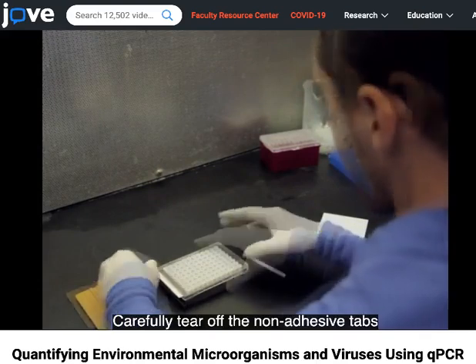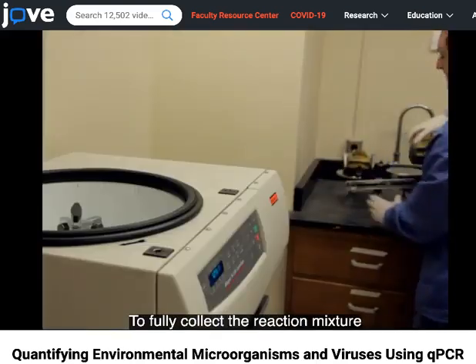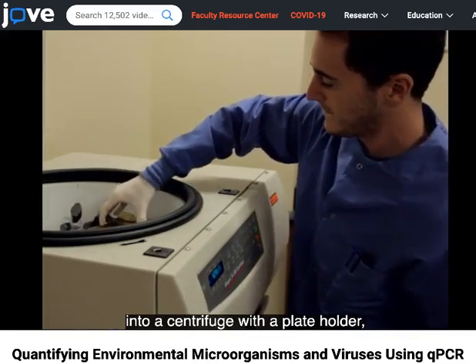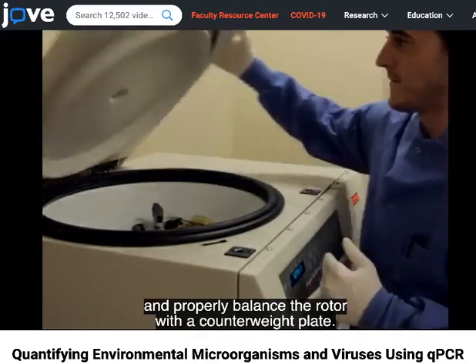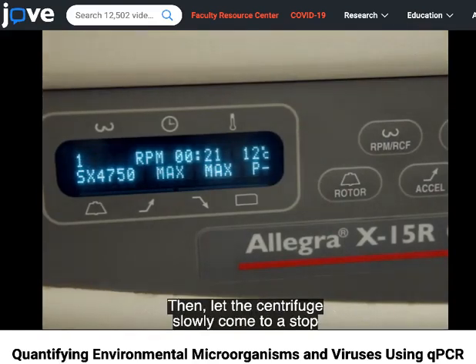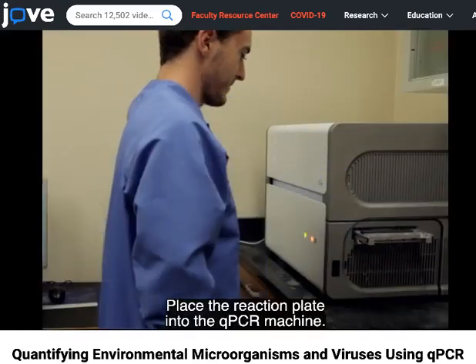Carefully tear off the non-adhesive tabs from the ends of the seal. To fully collect the reaction mixture into the bottom of the wells, place the reaction plate into a centrifuge with a plate holder, and properly balance the rotor with a counterweight plate. Pulse centrifuge the plate up to 1000 RPM, then let the centrifuge slowly come to a stop without brakes. Place the reaction plate into the qPCR machine.